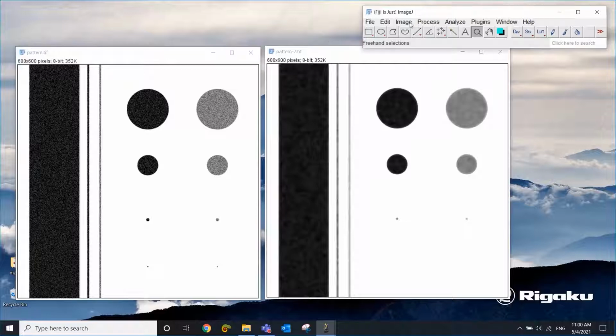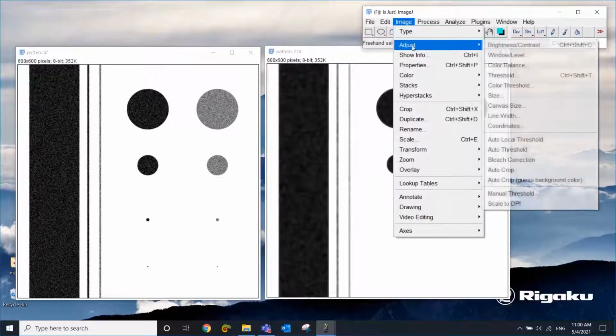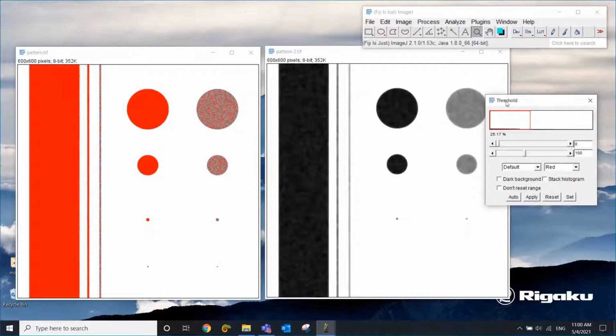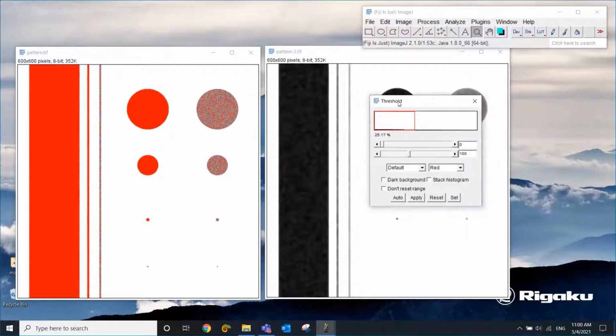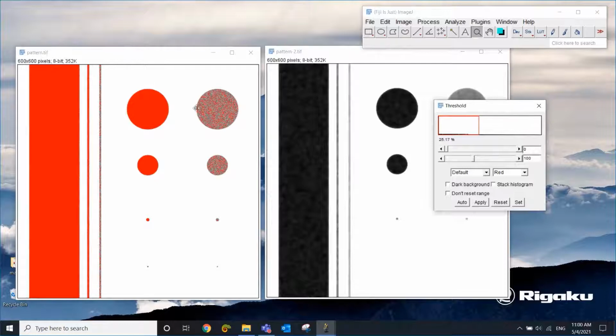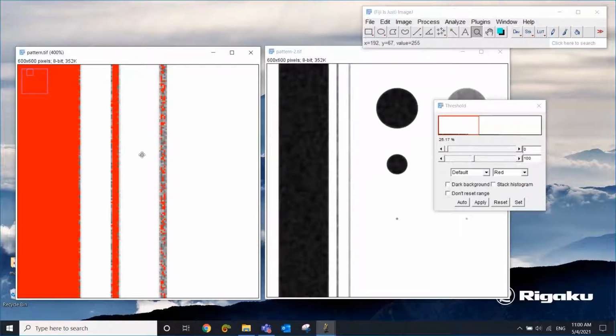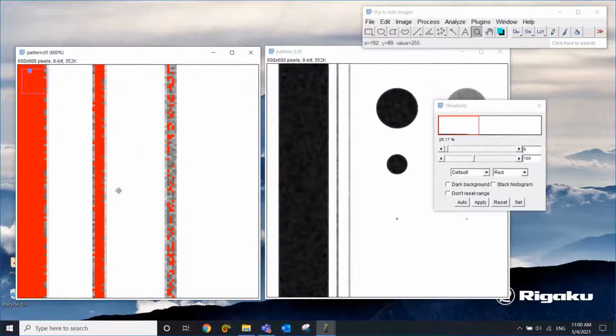And to do that, you can go to Image, Adjust, and Threshold. If you use the original image, you realize that the gray areas are partially selected. That's not what we really want. We want to select the black areas, but not the gray areas. Now let's look at those 2 lines, black and gray lines.